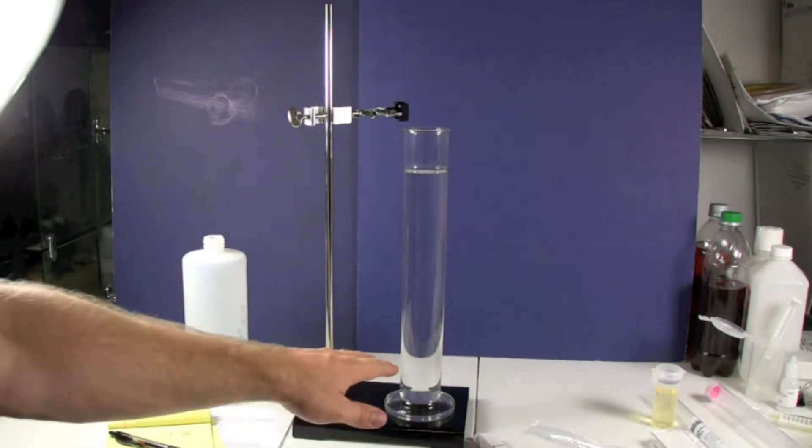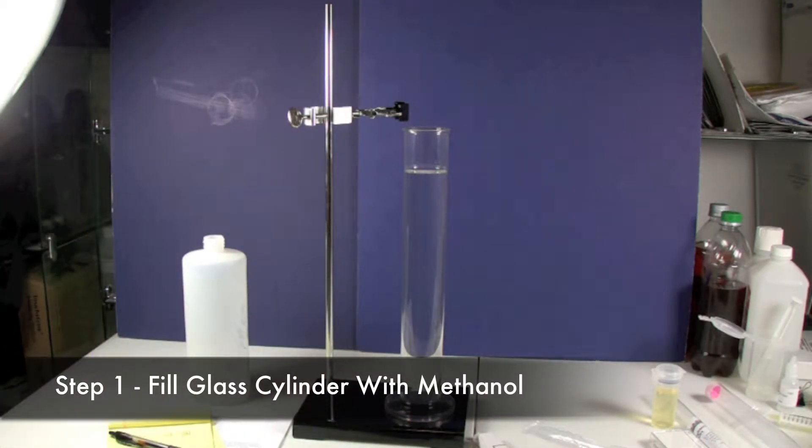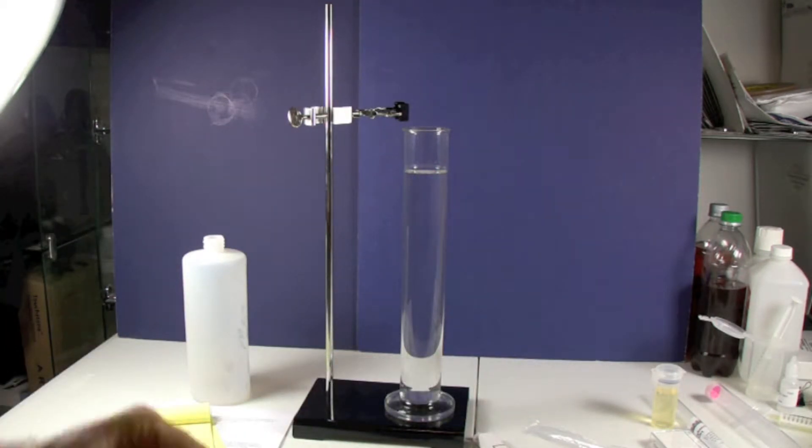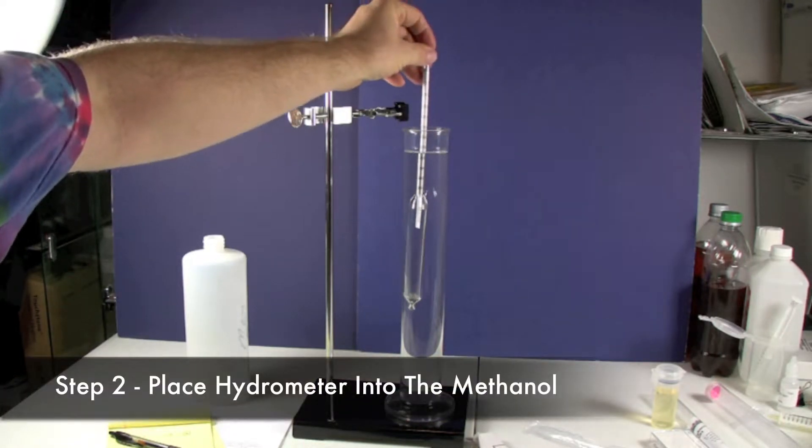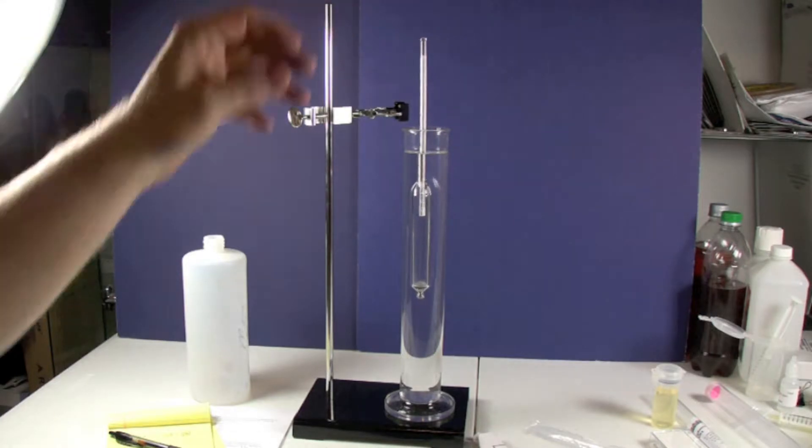So first thing that we've done is we've filled this vessel about almost as full as we can get it with methanol. And we're going to put the hydrometer in first and we're going to just let it stabilize.